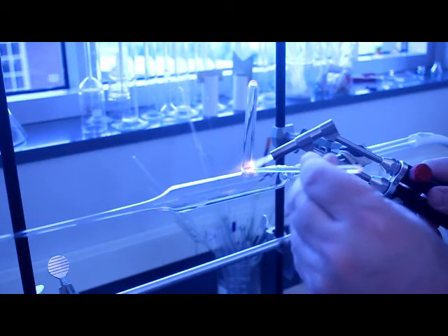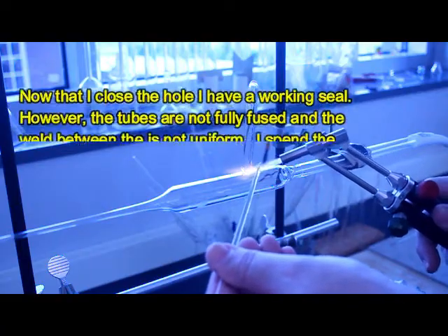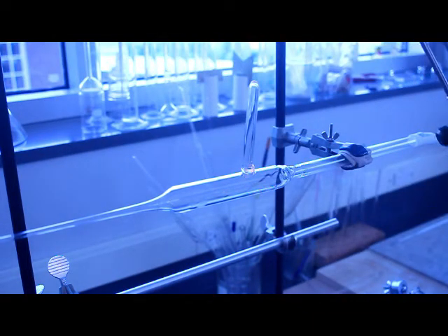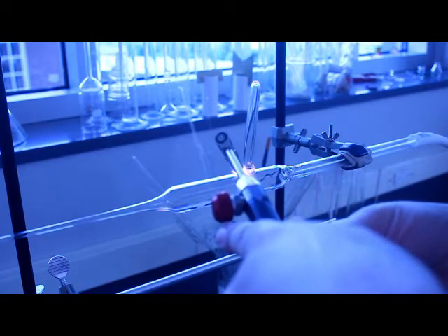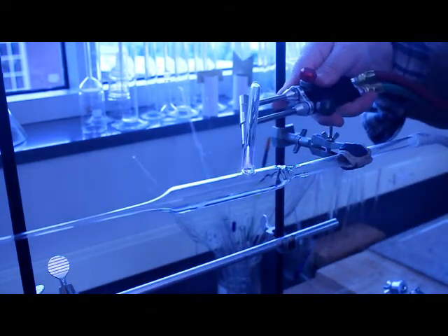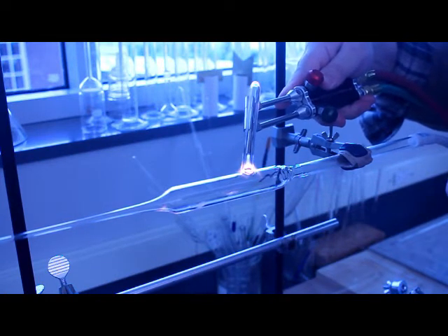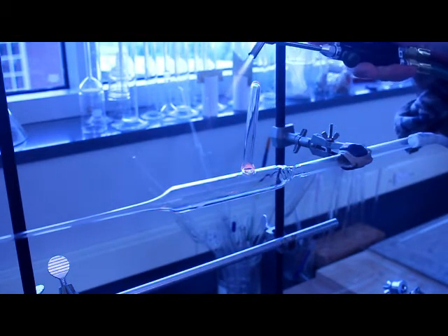So here I am now patching that hole because I had to do it in two steps. While I was moving around the glass I wasn't blowing into it, but now that I've actually sealed the hole right here now I can actually use my blow hose and puff into the glass to shape it. This is something that it's very easy to overheat the glass, puff too hard and have it distort, and I've done that many times where I'm working on a piece of glass tubing, I heat it up too much and I blow too hard and I end up with this very large blister. So again what I'm working on right now is purely a demonstration, purely a test piece, and it's the kind of thing that my students in the future will be working on projects. But before you do that you just need to learn these basic techniques, go into the lab, work with a hand torch, work with a bench burner.